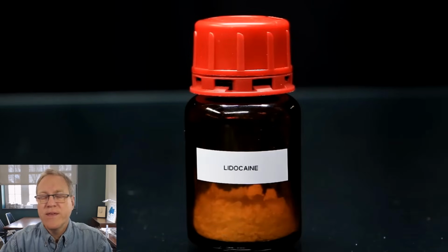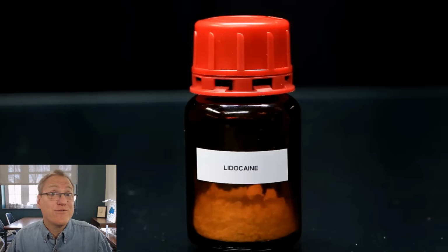Now before he leaves this image, see that bottle? That is an old chemical bottle where he has used the reagent, he's cleaned out the bottle, and now he's using it to store different things that he's made. Almost all chemists do this in some fashion, but chemical suppliers supply their products in these nice amber bottles, typically to protect the product from light. And it's nice to be able to store the stuff you make and the stuff you gather in these same kinds of bottles. So labs are full of these reused bottles very often.